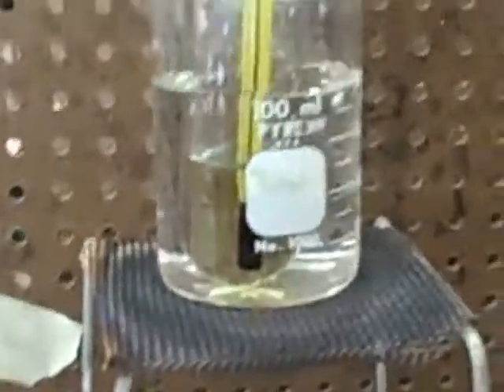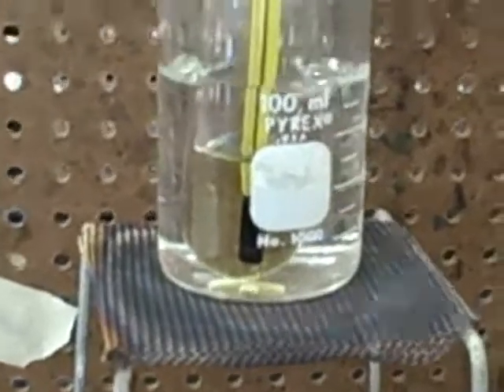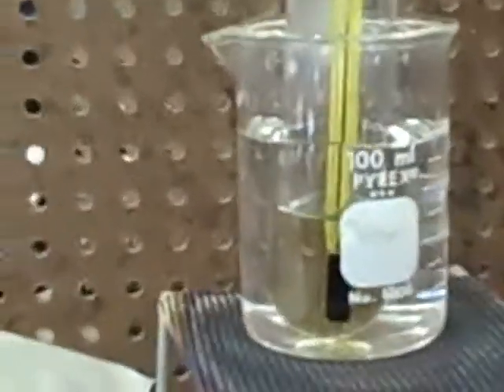Okay, so now we have to stop the gas and then stir it. We gotta get the tip — take this out. The water was... ninety-four. Ninety-four degrees Celsius. Now, what do we do now? It's completely melted. I'll tell you when it's time — make sure that the solid in the test tube is contained. I have my watch, Jason, so we'll just go on the same thing.